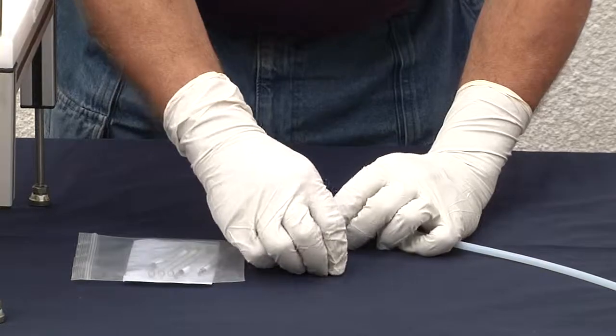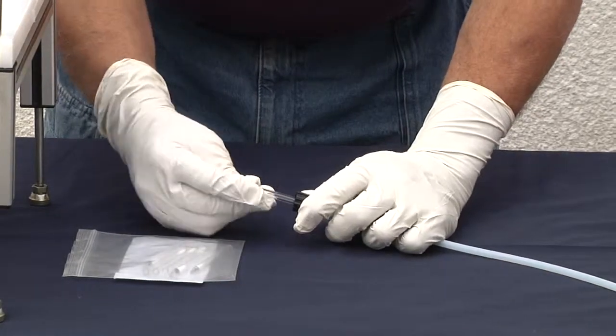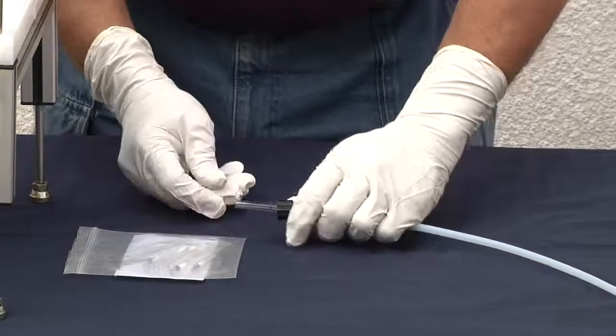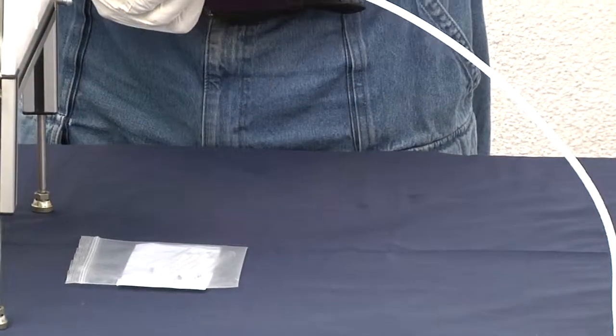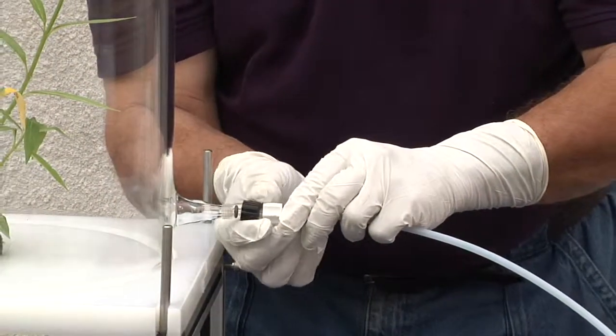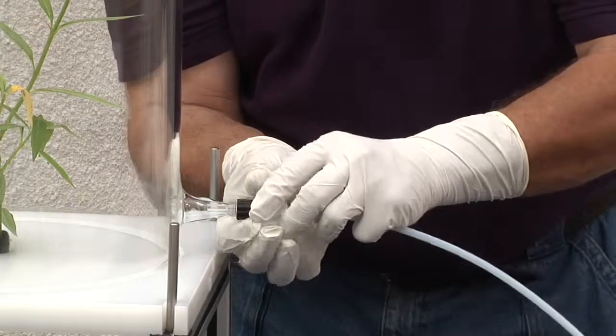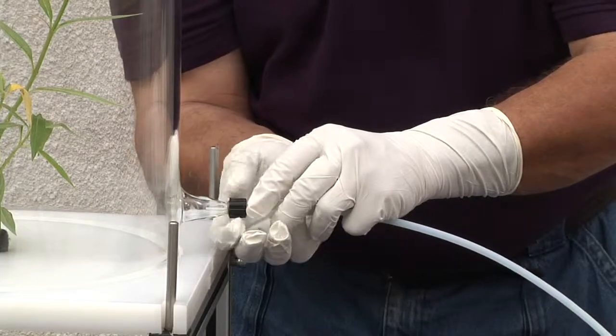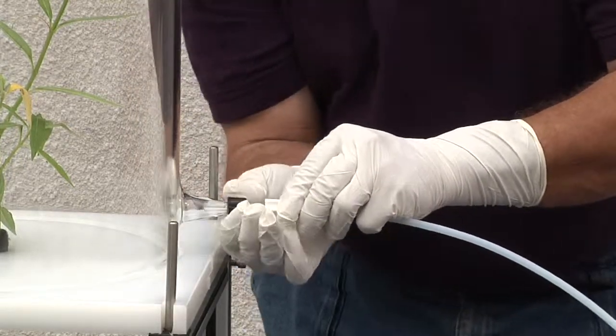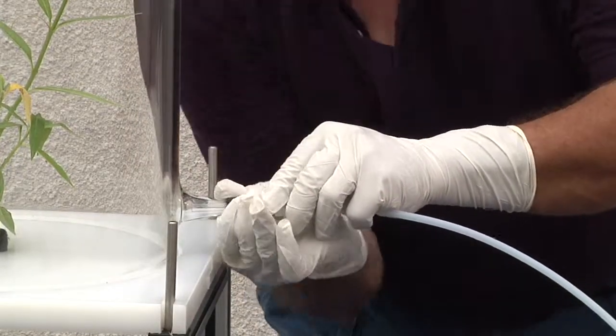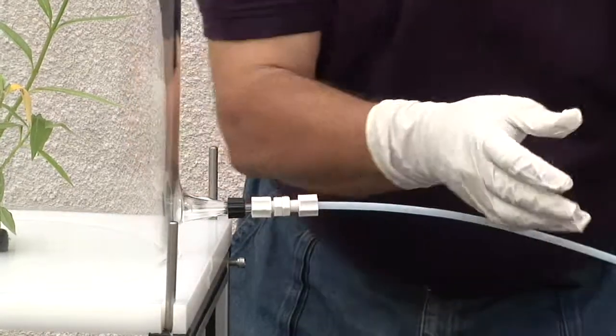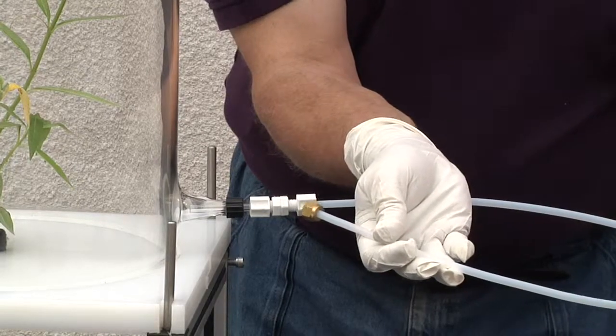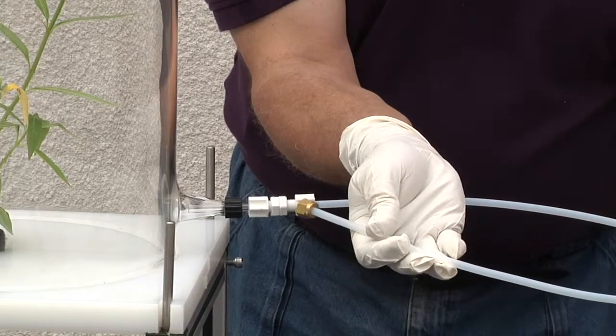The last part of course is to attach the VCT to our chamber which we put in the cap, our o-ring, and then we insert into our chamber to the depth we are looking for and slowly tighten our cap until our VCT is locked into our chamber. Now we're ready to attach our tubing to our vacuum source so we can start our experiments.